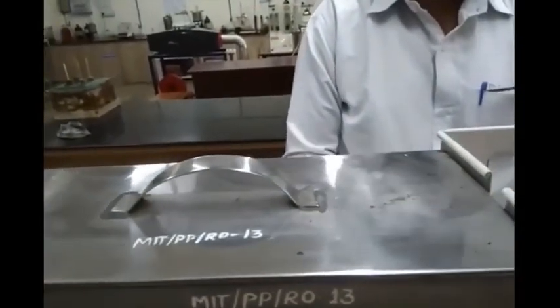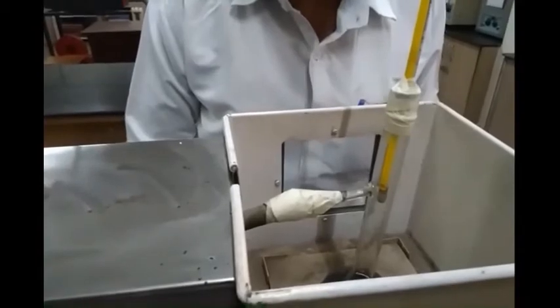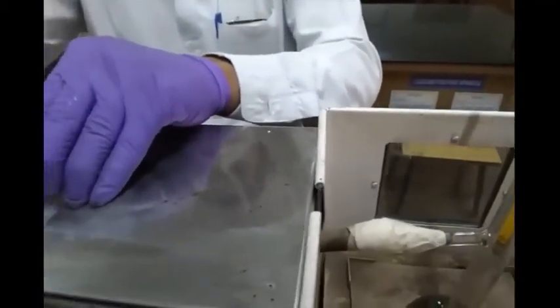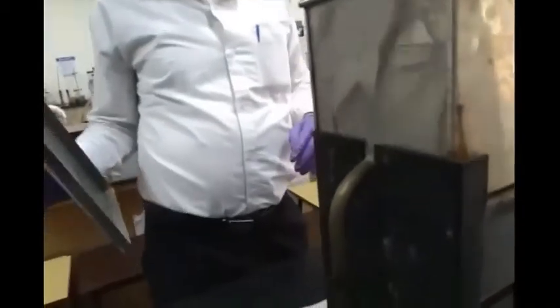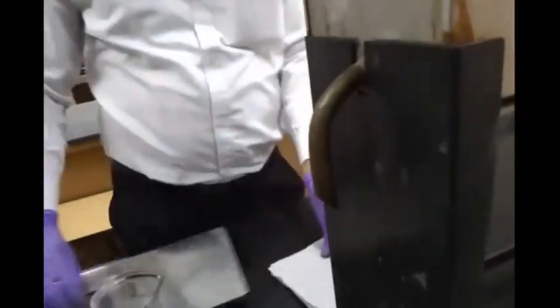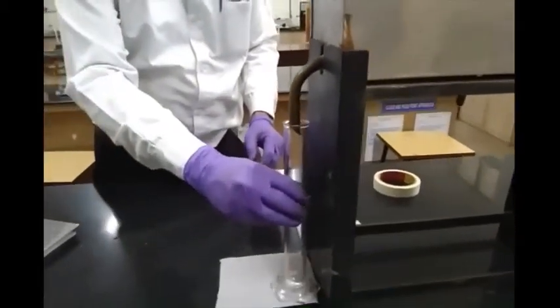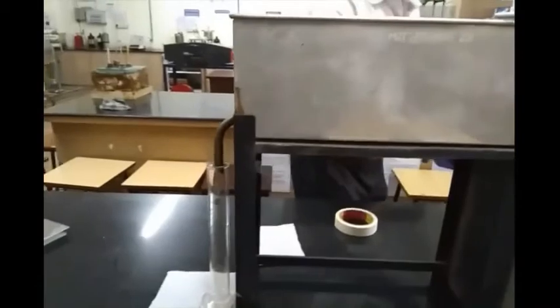The condenser we are dealing with is a water-cooled condenser. This is a tank where we have the water inlet. If you open this tank and look inside, you'll see the water. The vapors will be passing through the water and they will be collected on the other side through a receiver. This distilled liquid will be collected in a measuring cylinder so that we can measure the actual volume versus temperature.